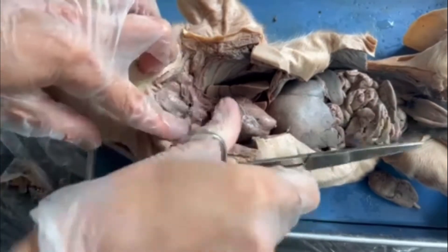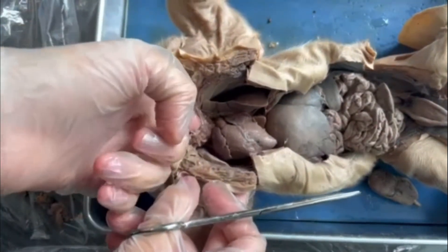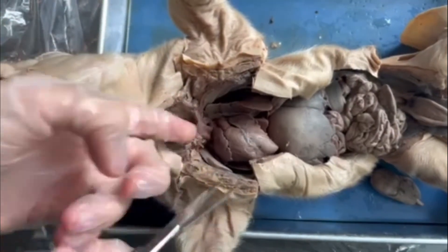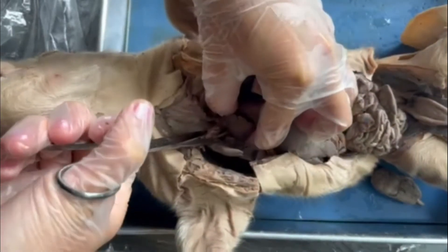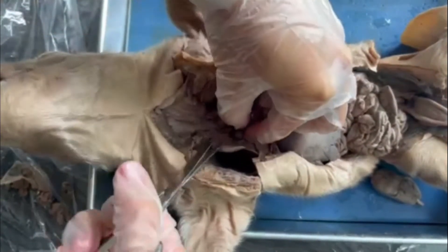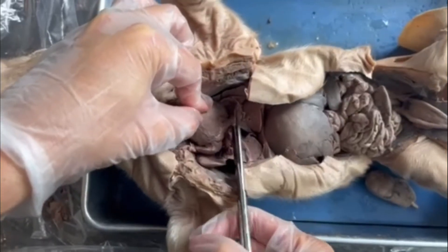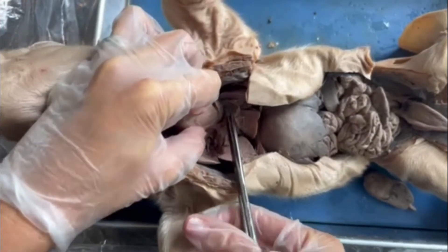I really want to see where the trachea goes into the lungs, so I'm going to try to get the heart and the major blood vessels out of here. I can see the trachea, and this tissue — which is pretty much just aorta and its blood vessels above the heart — is not attached to the trachea. So I'm going to lift this as much as I can, use my finger to separate it, trim, and make sure the trachea still looks good. Beneath the heart, there's usually an inferior vena cava, so I'm going to cut that blood vessel and detach it.